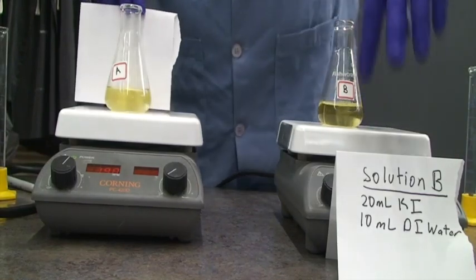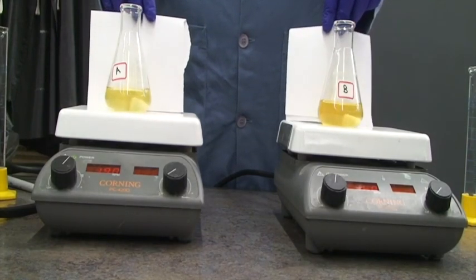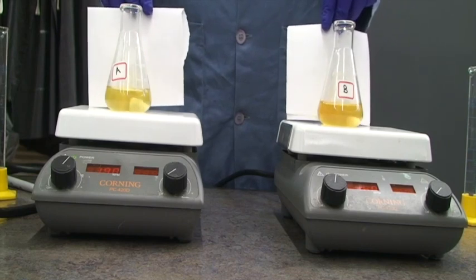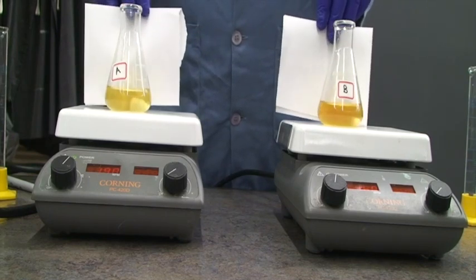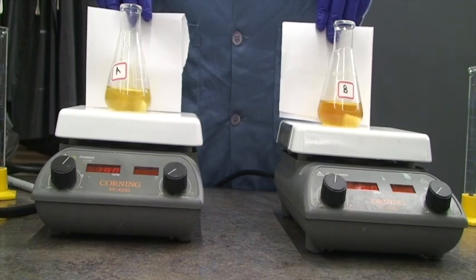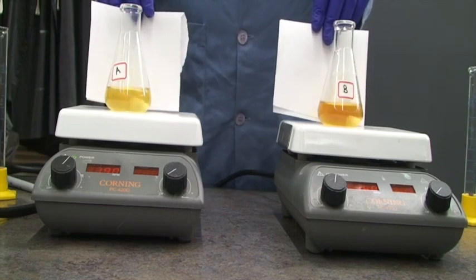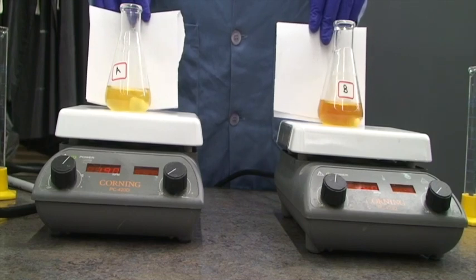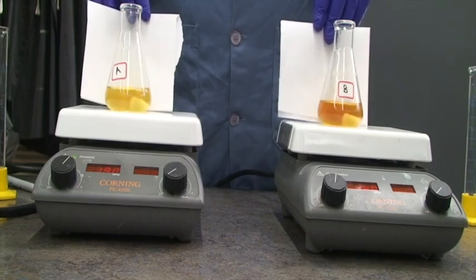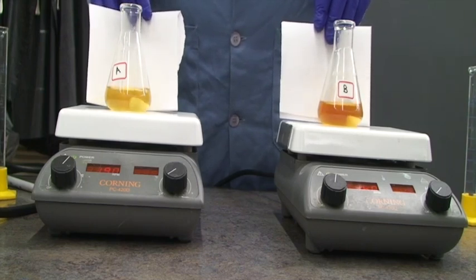You can see that for both reactions the solution is turning yellow — going from clear to yellow. That yellow color is coming from one of the products, I₂ (iodine), which is slightly soluble in water and has a brownish-yellow color. The more intense the color, the higher the concentration of iodine in solution. You'll also notice that solution B is darker than solution A, because we used more KI, so the concentration of KI is affecting the rate of this reaction.